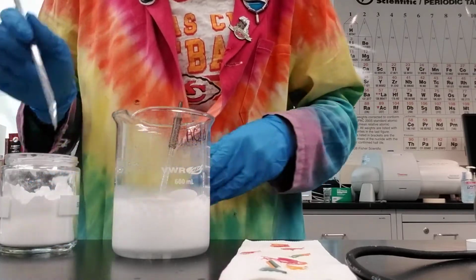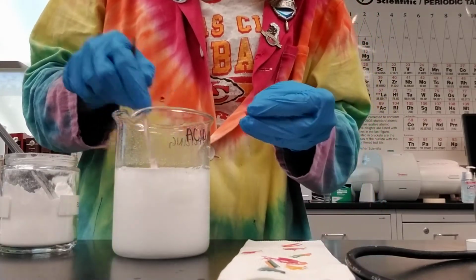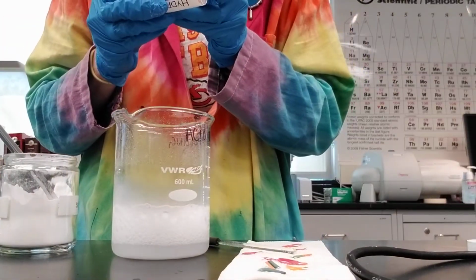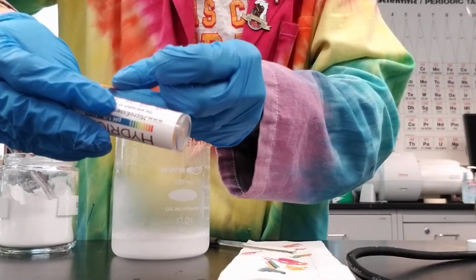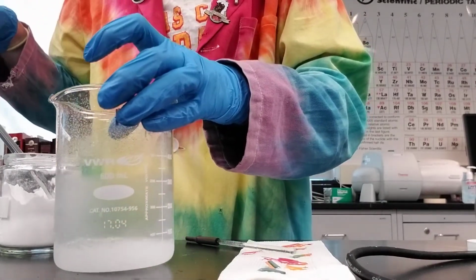I'm going to stir it really good here. And I just test the pH, and it's now kind of a yellow color, yellowy orange color, which to me kind of is between the pH value of 6 and 7, which means this is ready to be dumped down the drain, and I'm all finished neutralizing.